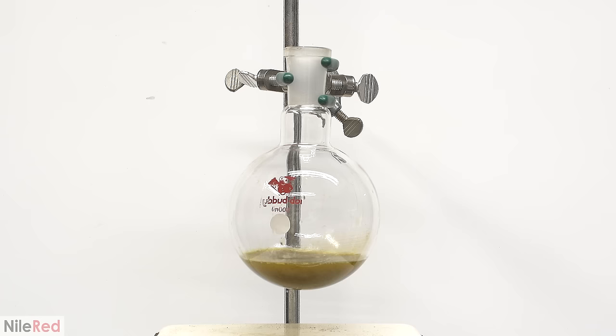Everything is transferred to a small beaker and I add some isopropanol. The hot plate is turned on and everything is dissolved. The initial amount of isopropanol that I added was a little bit too much, so I let some boil off. The beaker is covered with plastic wrap and I place it somewhere to cool. It's really important that it cools down slowly, otherwise the crystals turn out pretty crappy.